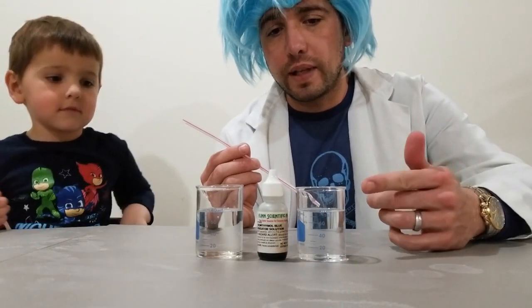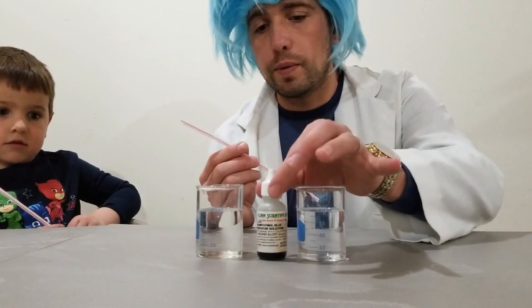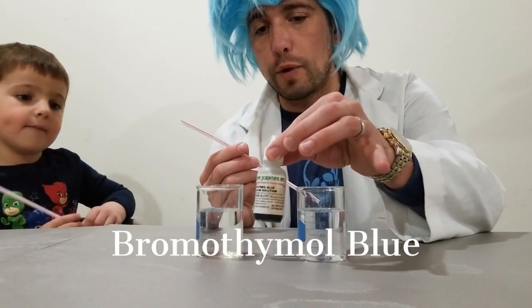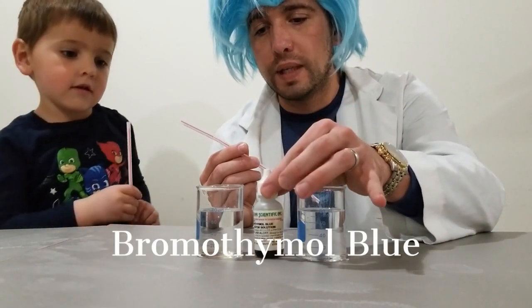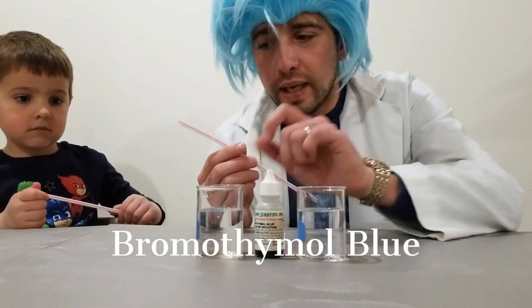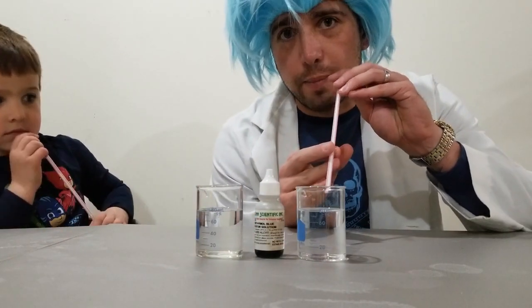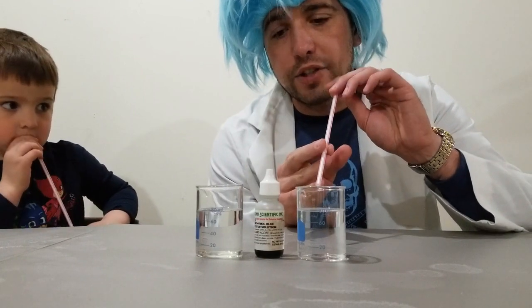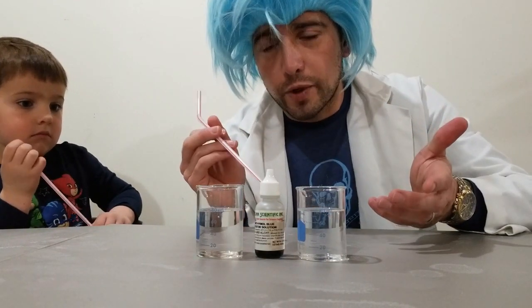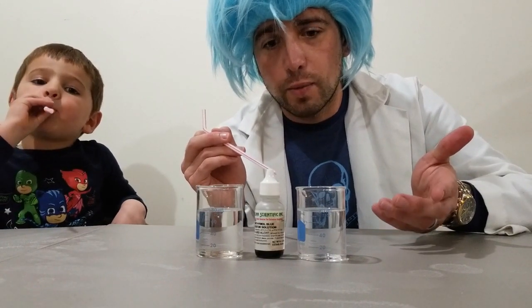So what we're going to do today is we're going to put some acid-base indicator — this is bromothymol blue — into some of our tap water, and then we're going to use straws and blow bubbles into the tap water and see how that changes the color of the indicator, which means how it changes the pH of the water.